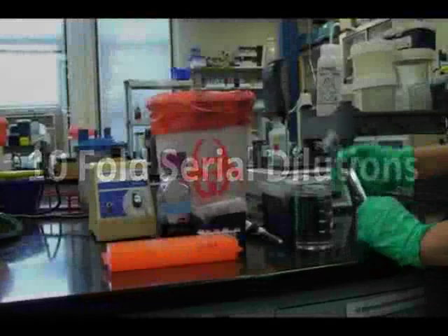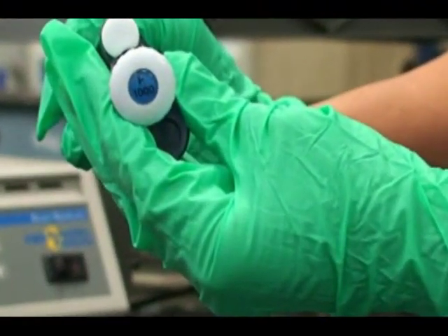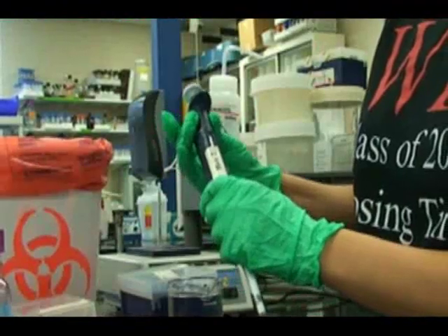How to perform 10-fold serial dilutions. First take a 1000 microliter pipette man and set it to 900 microliters.